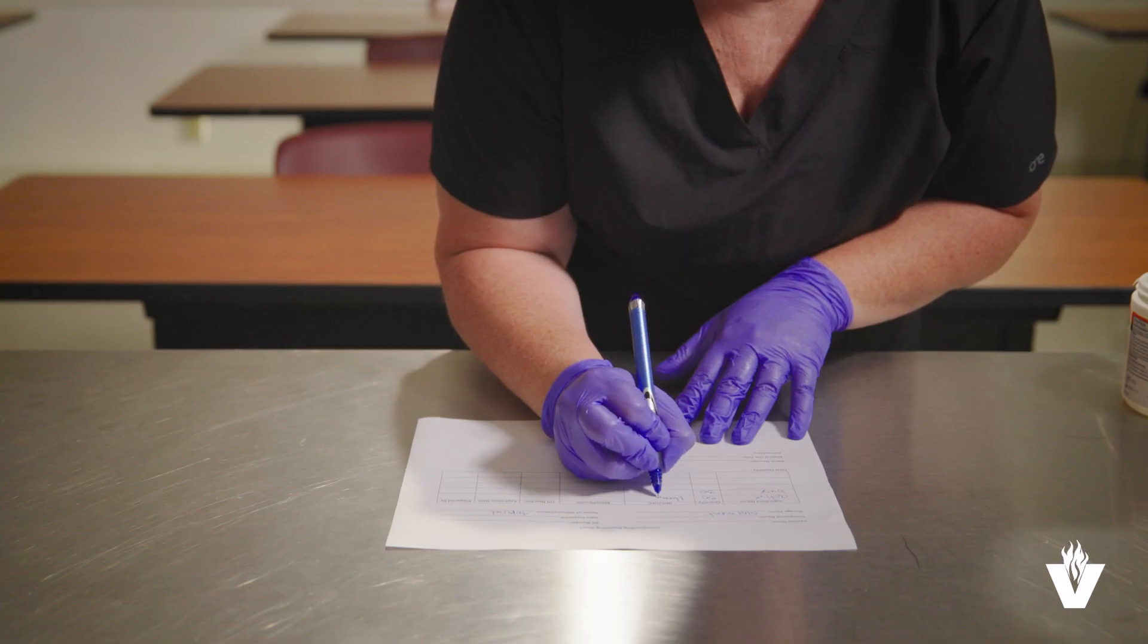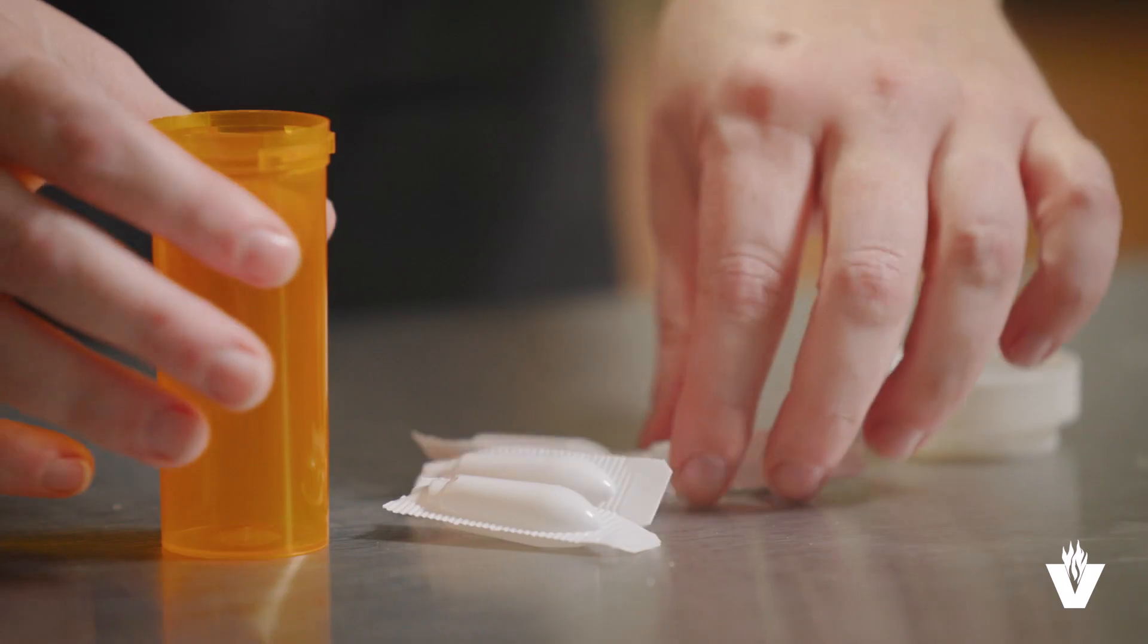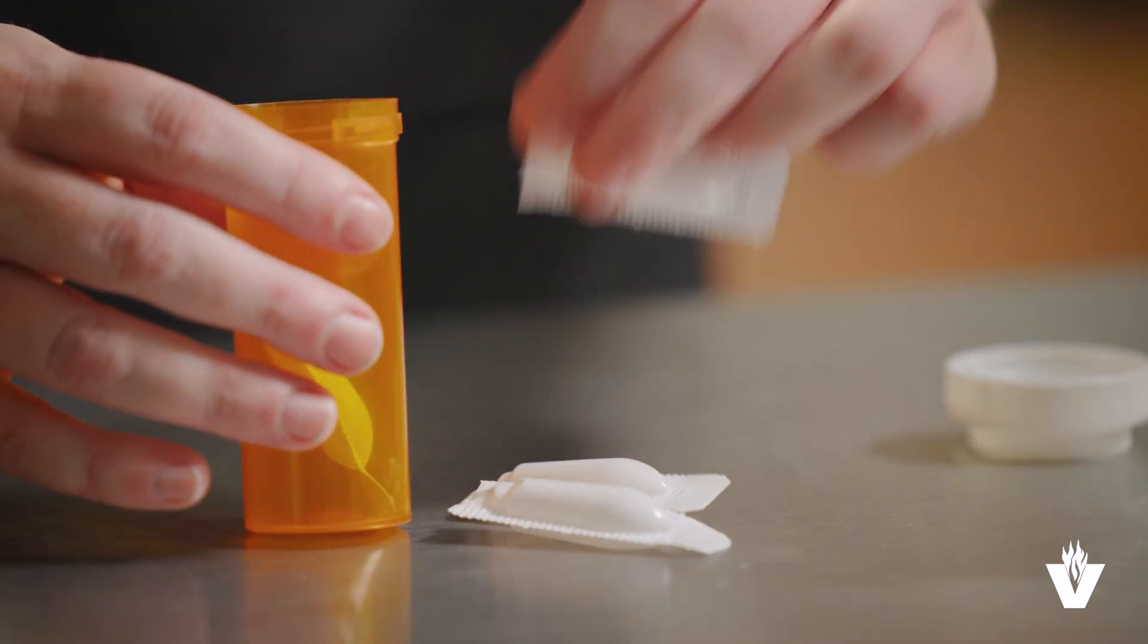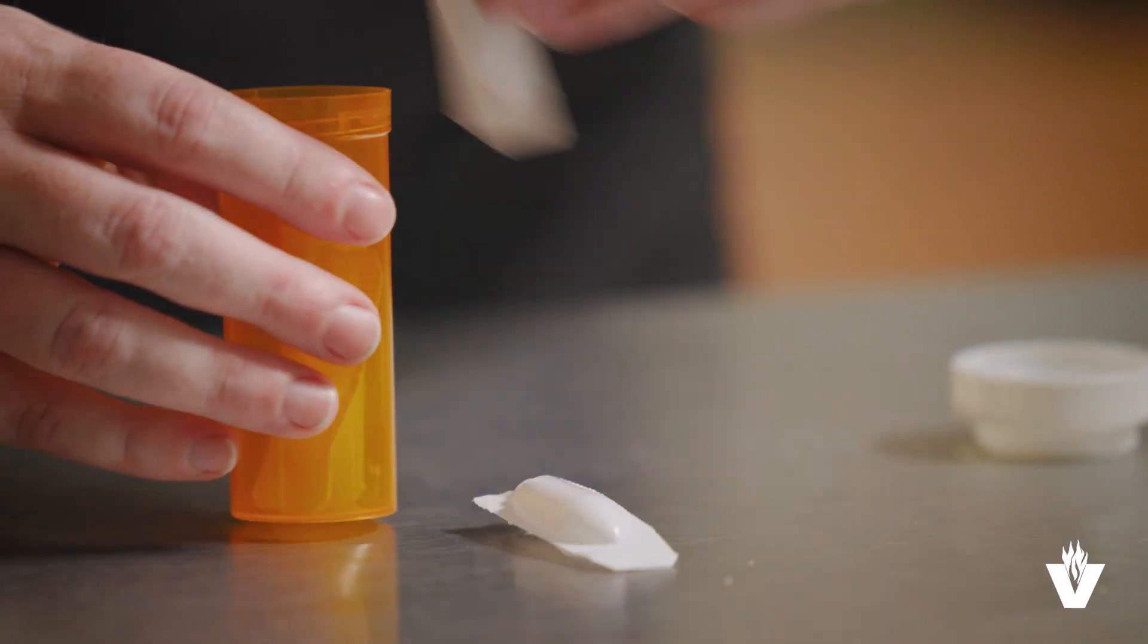Your compounding recipe should indicate what each suppository should weigh individually so you can check your accuracy of the compounded product. Once the compounding recording sheet is complete and the suppositories are sealed, they are ready to be dispensed and may be stored in the refrigerator to prevent melting.